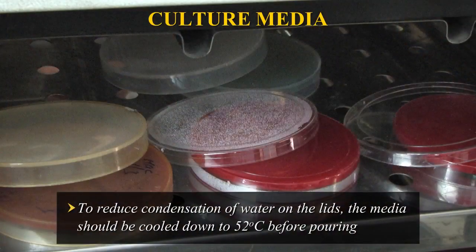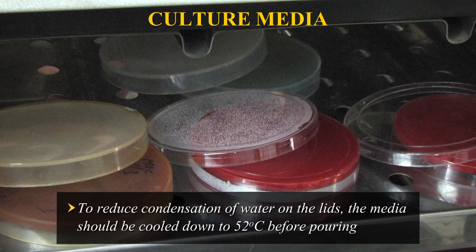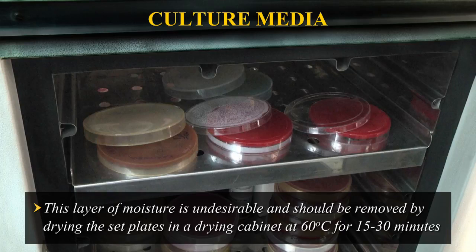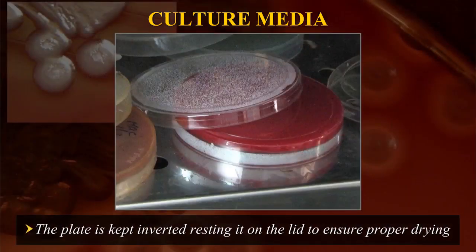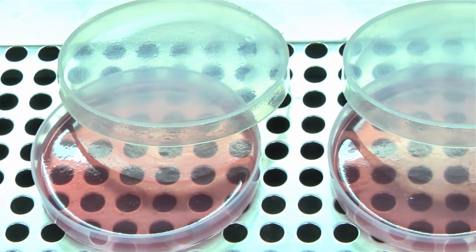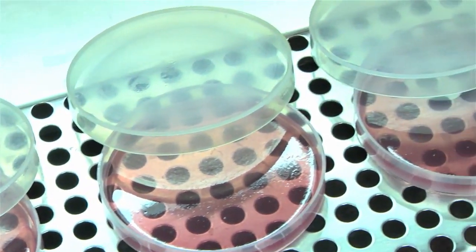To reduce condensation of water on the lids, the media should be cooled down to 52°C before pouring. When plates have been poured, the steam from the hot liquid condenses on the surface of the medium. This layer of moisture is undesirable and should be removed by drying the set plates in a drying cabinet at 60°C for 15–30 minutes. The plate is kept inverted, resting it on the lid to ensure proper drying. All poured plates should have even depth and formed firm gel. The surface of the agar plates should be smooth and free from bubbles.